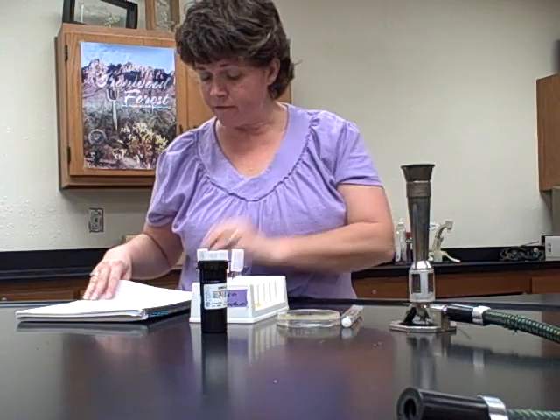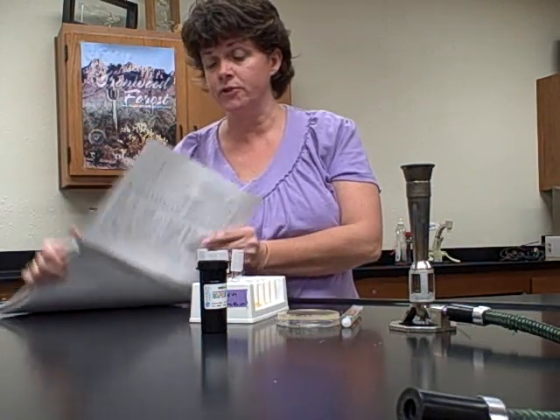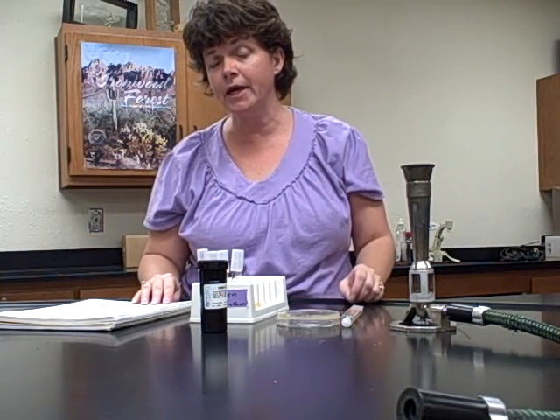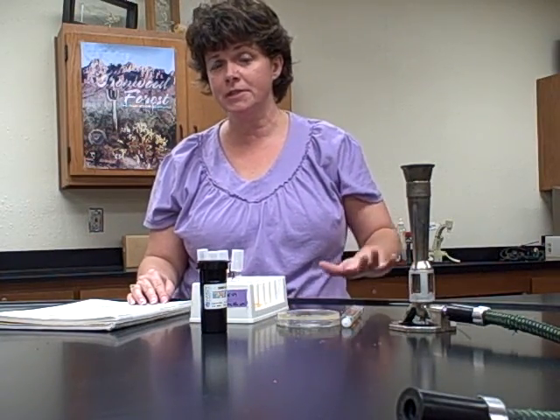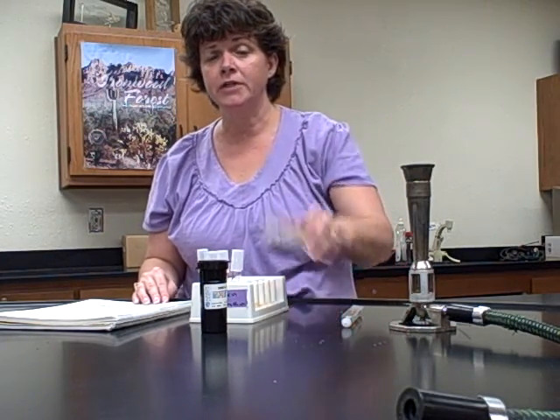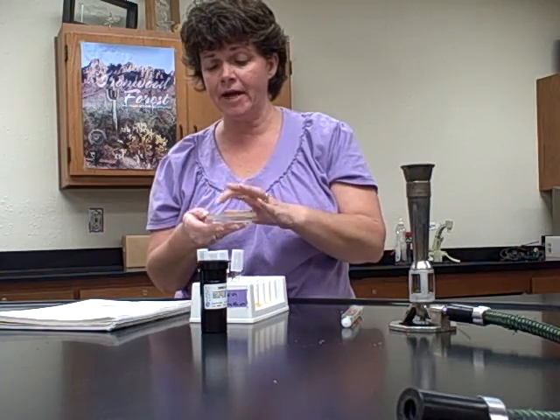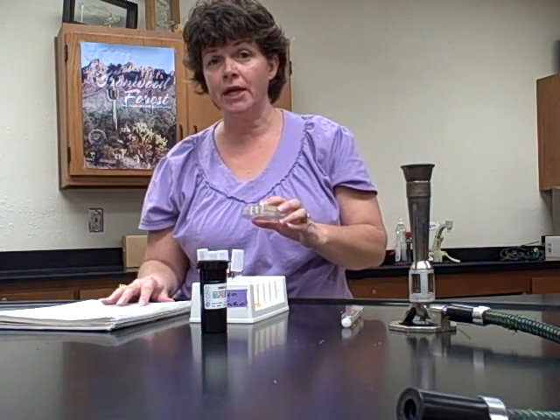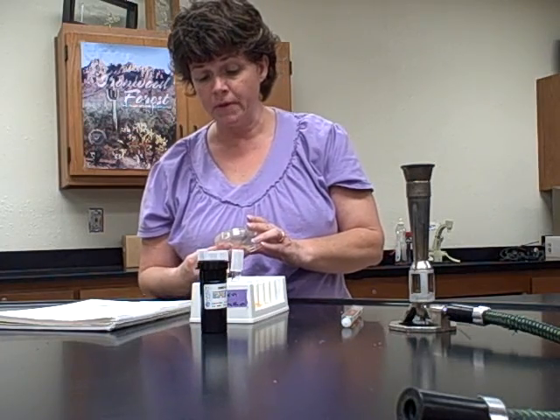Now, I would like for you to look on page 108 first. Okay, on 108 it says that you're actually going to streak the plate. Well, you're not going to do that because that's going to be done for you already, since we only meet once a week, you guys won't be streaking the plates. So you'll actually be provided with a plate. It'll have an unknown number on it. So you go ahead and just write that number down. That'll be the unknown for your group.